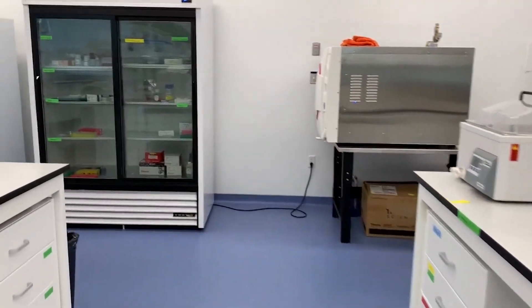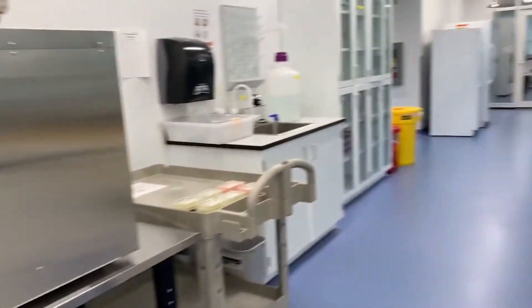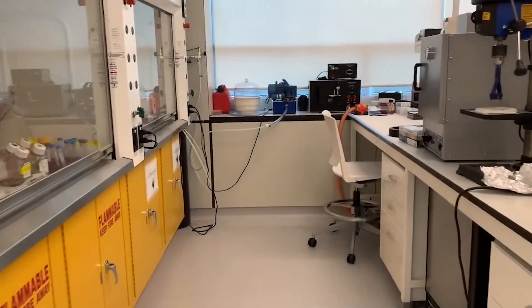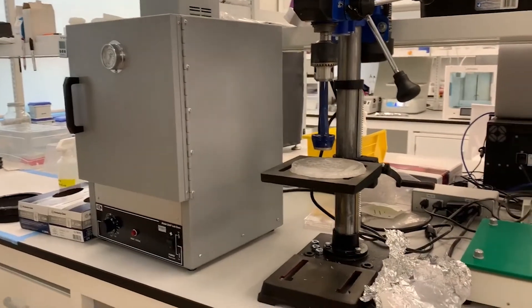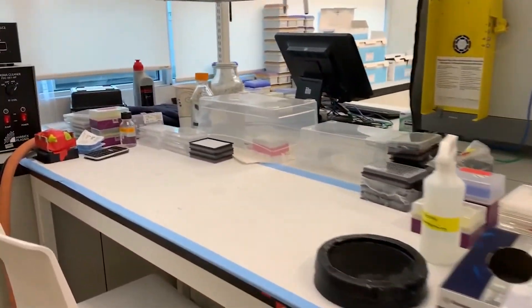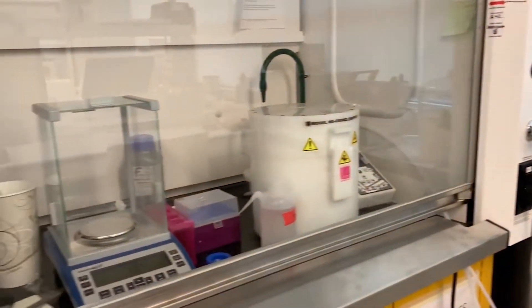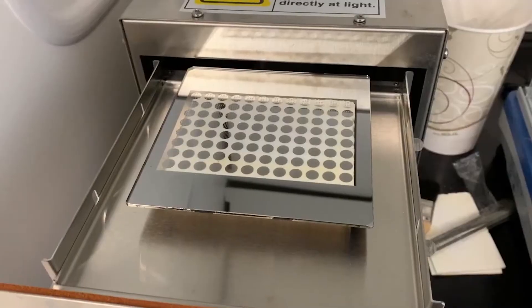Let's move on now to our microfabrication bench. Here, we prepare part of our niche engineering work by designing and developing substrates where cells will sit in a controlled way. Here, we use a plasma cleaner, a spin coater for glass passivation, and deep UV to create patterns for cells to grow on in different shapes and sizes.